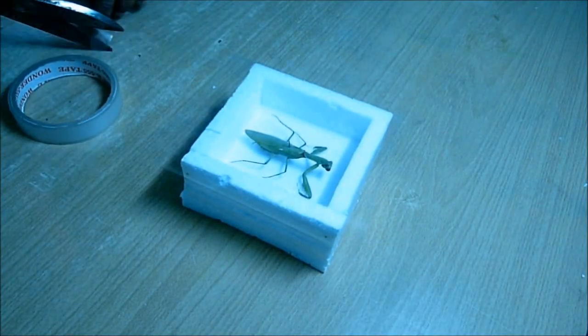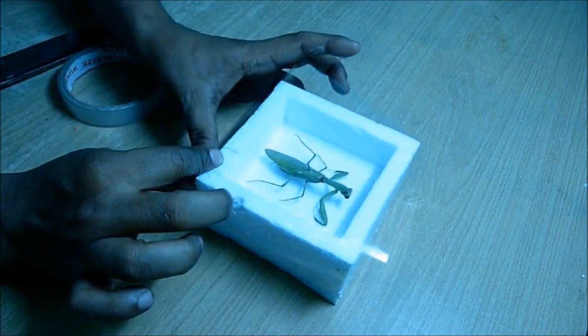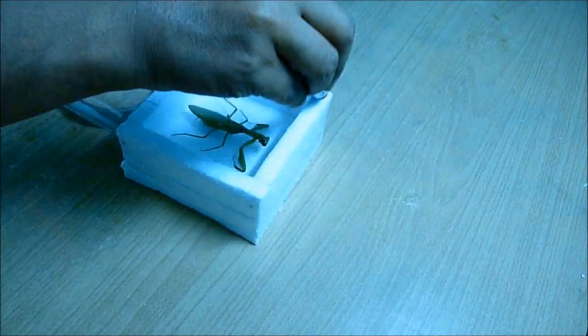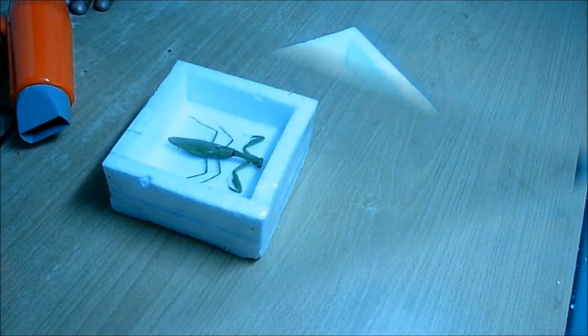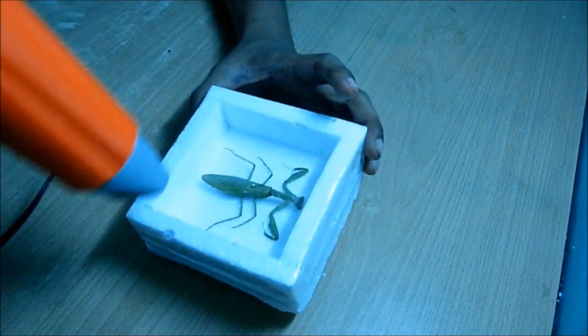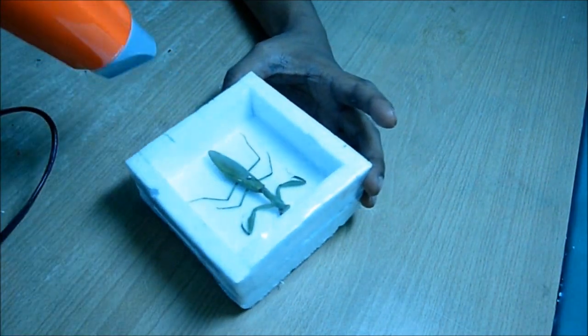To have a tight finish, a straight finish, I used hot air. I used a hair dryer and put hot air to give it a nice straight finish on the top.